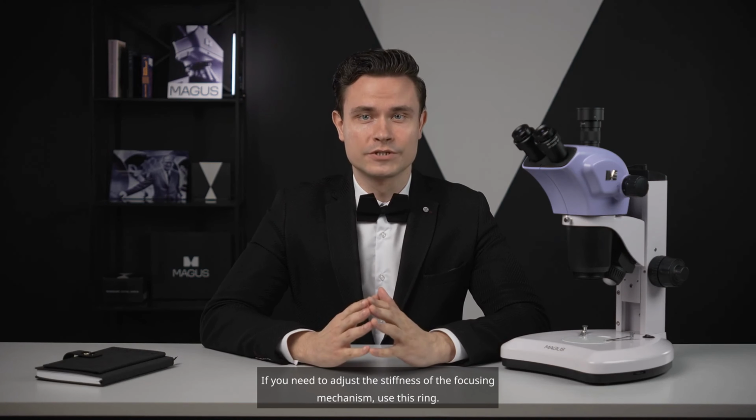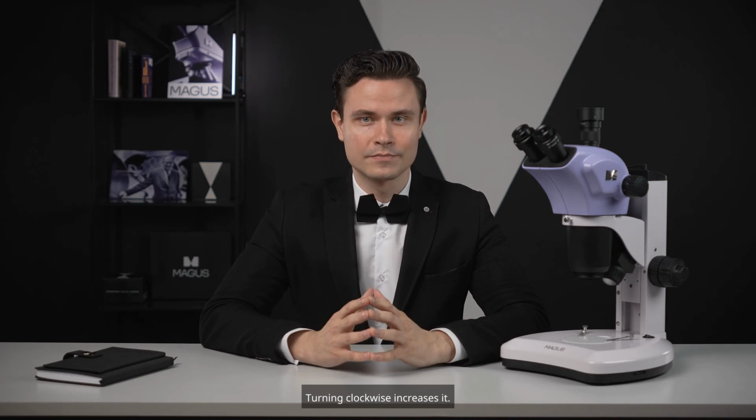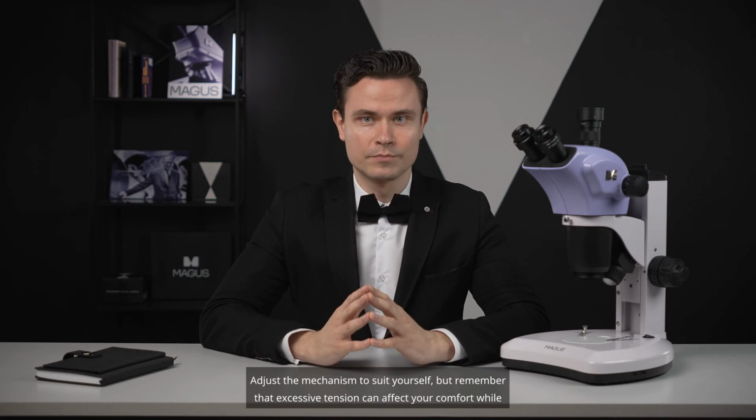If you need to adjust the stiffness of the focusing mechanism, use this ring. Turning counterclockwise decreases stiffness. Turning clockwise increases it. Adjust the mechanism to suit yourself, but remember that excessive tension can affect your comfort while working.